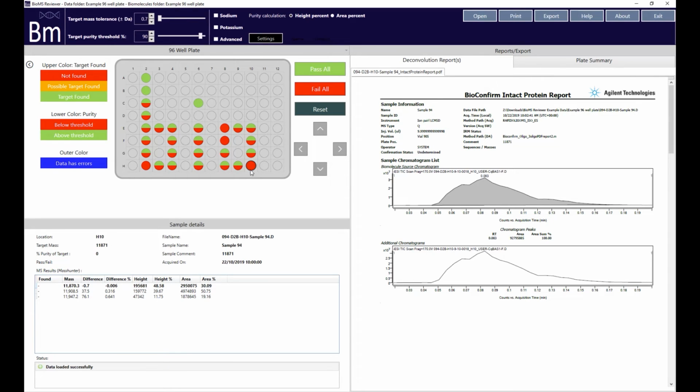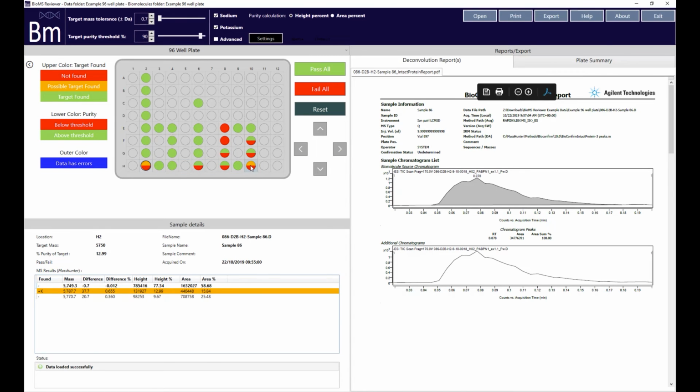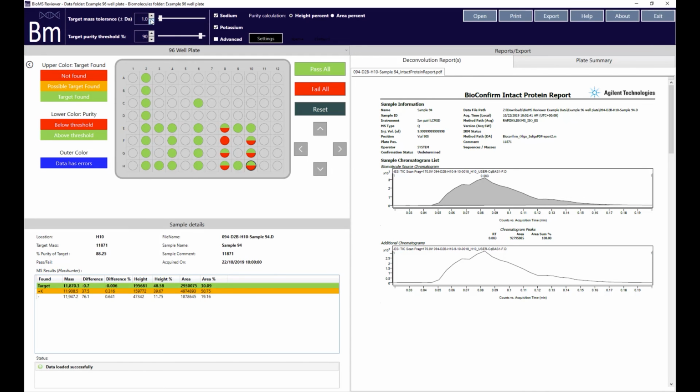By including sodium and potassium adducts in the calculations, using the checkboxes in the menu bar, we can see that wells H2 and H10 could only be identified as containing the target molecule because of a potassium adduct in each case. By increasing the mass tolerance to 1 dalton, more of the samples are identified as containing the target molecule. More information on the advanced options for annotating results will be shown in a separate video.